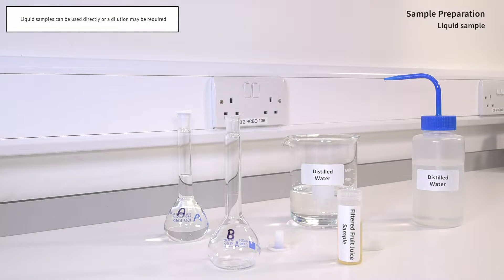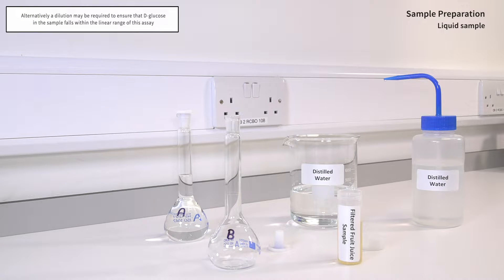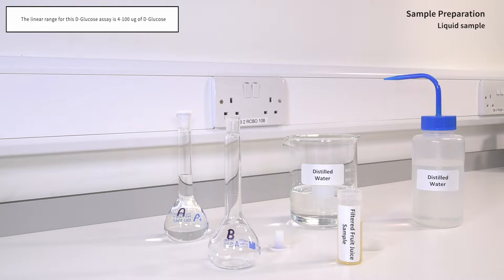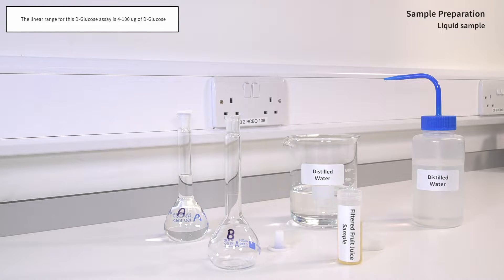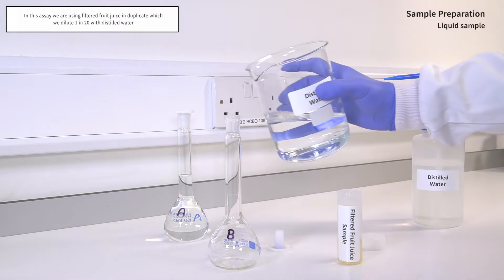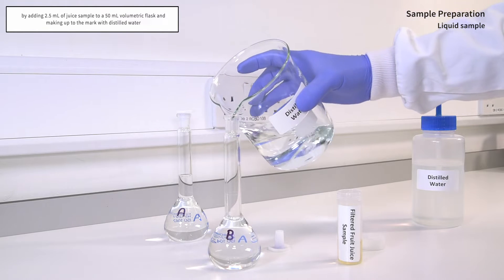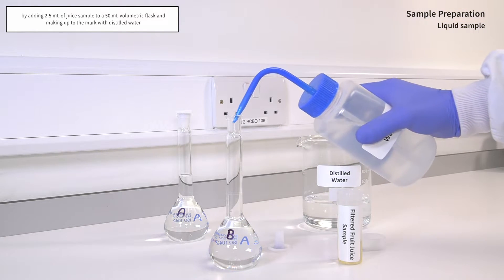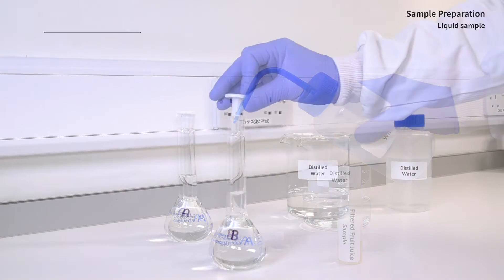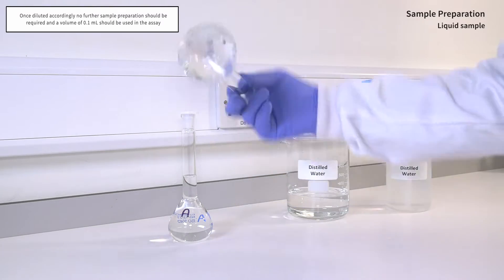Liquid samples can be used directly in the assay. Alternatively, a dilution may be required to ensure that D-glucose in the sample falls within the linear range of this assay. The linear range for this D-glucose assay is 4 to 100 micrograms of D-glucose. In this assay we are using filtered fruit juice in duplicate, which we dilute 20-fold with distilled water by adding 2.5 ml of juice sample to a 50 ml volumetric flask and making up to the mark with distilled water. Once diluted accordingly, no further sample preparation should be required and a volume of 0.1 ml should be used in the assay.